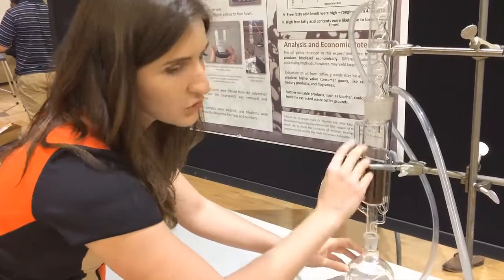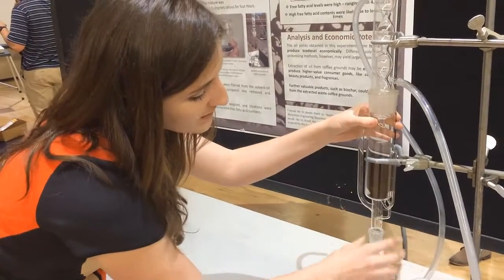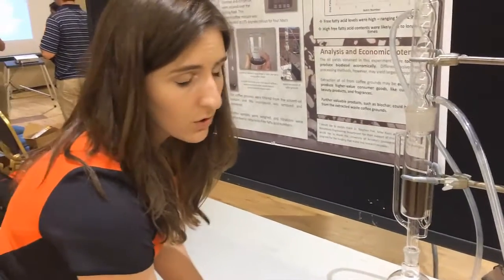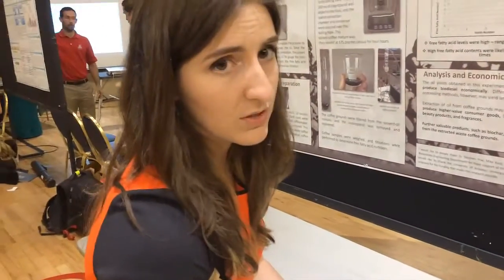And so this process just keeps going, and this bulb right here fills up with solvent and goes down here, extracts a little bit of oil, and it continues for about 12 hours until you've extracted most of the oil out.